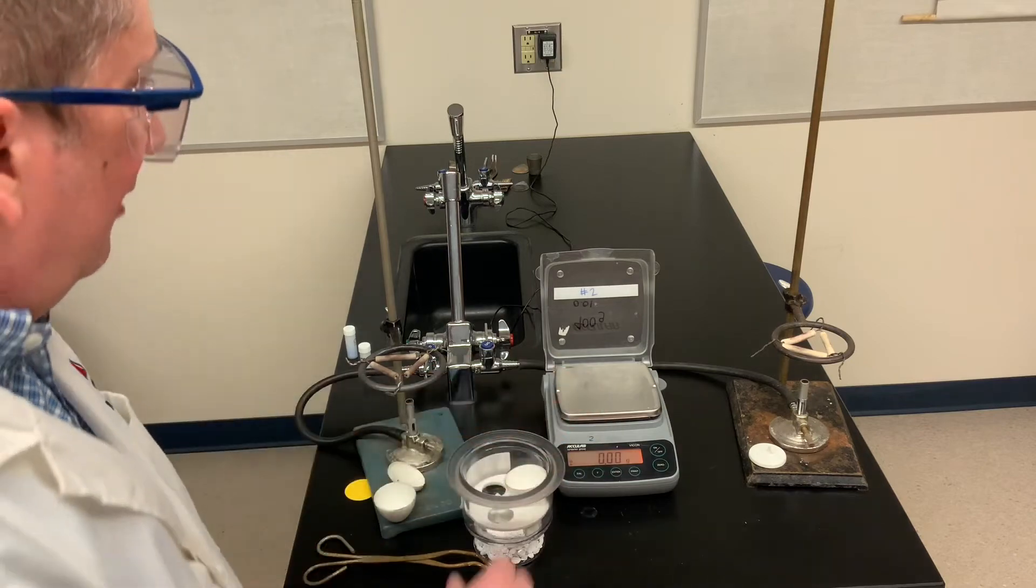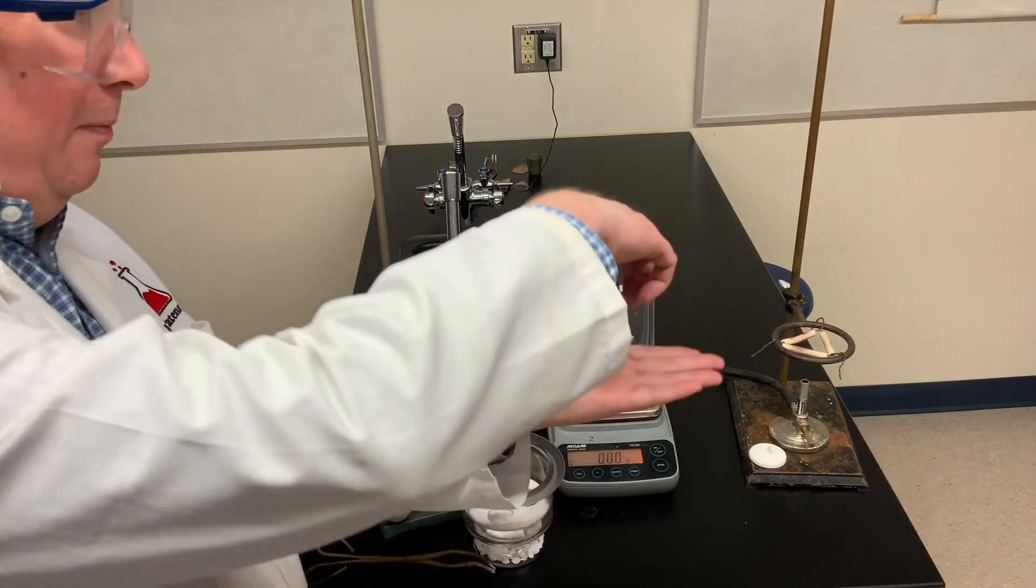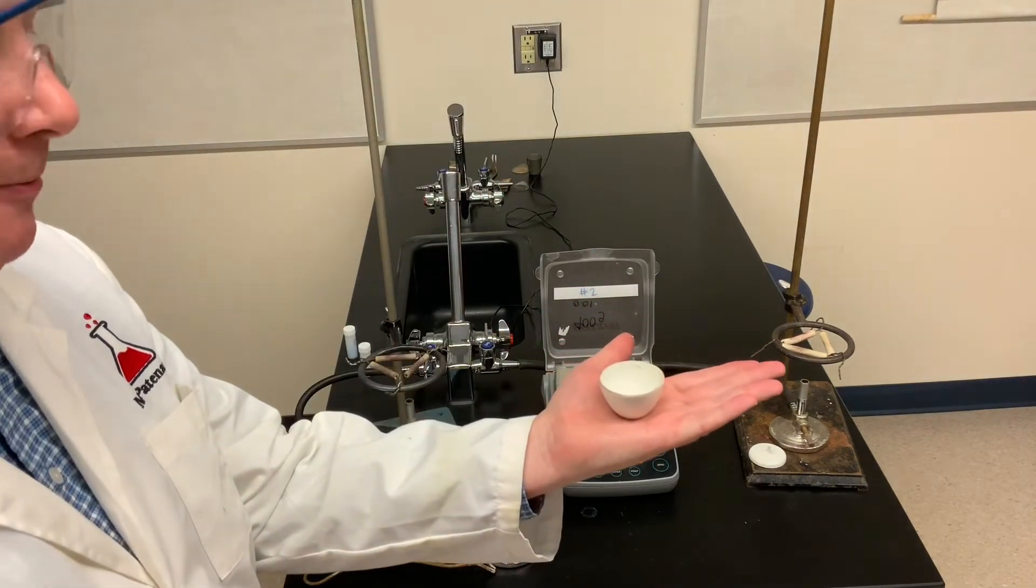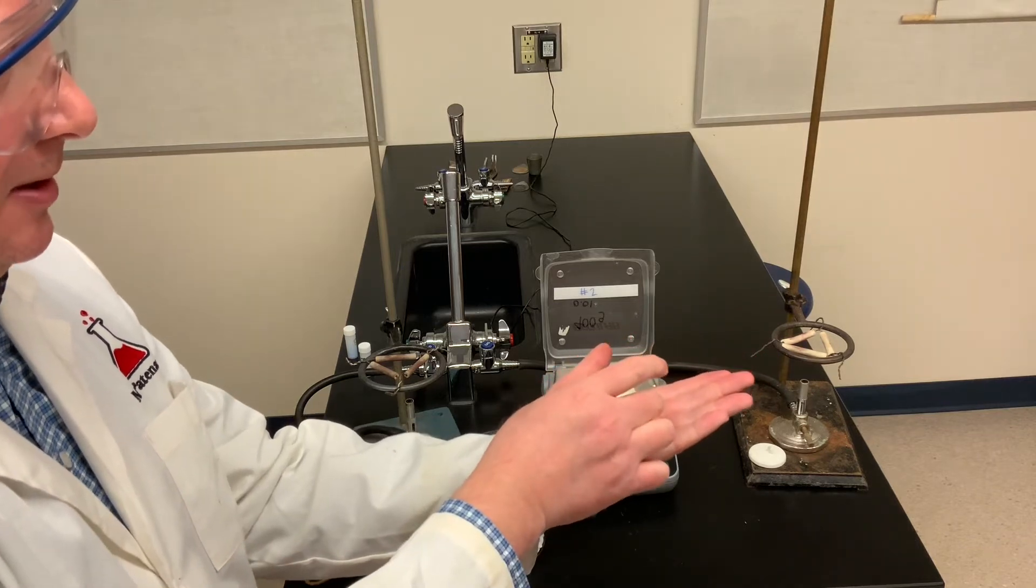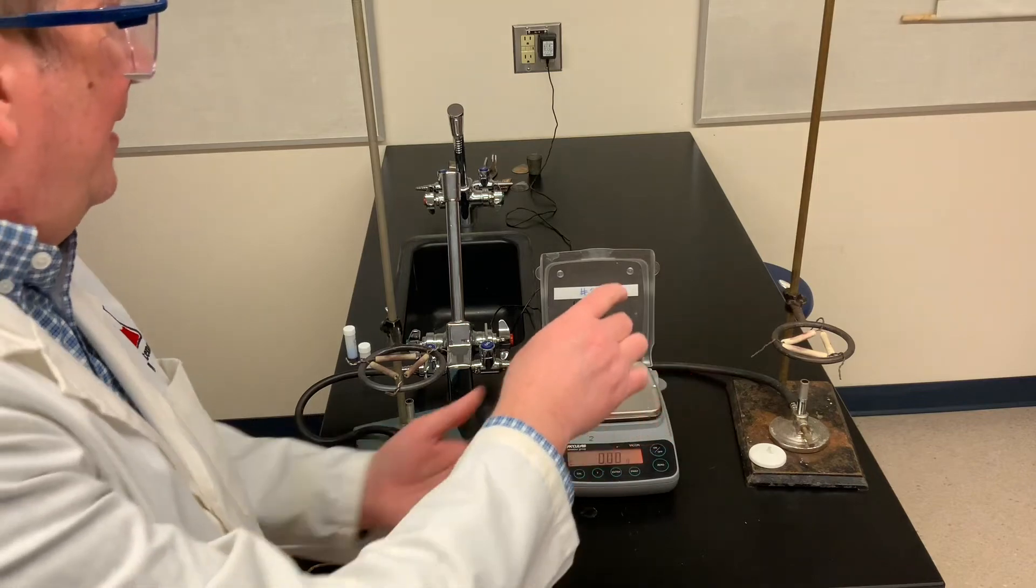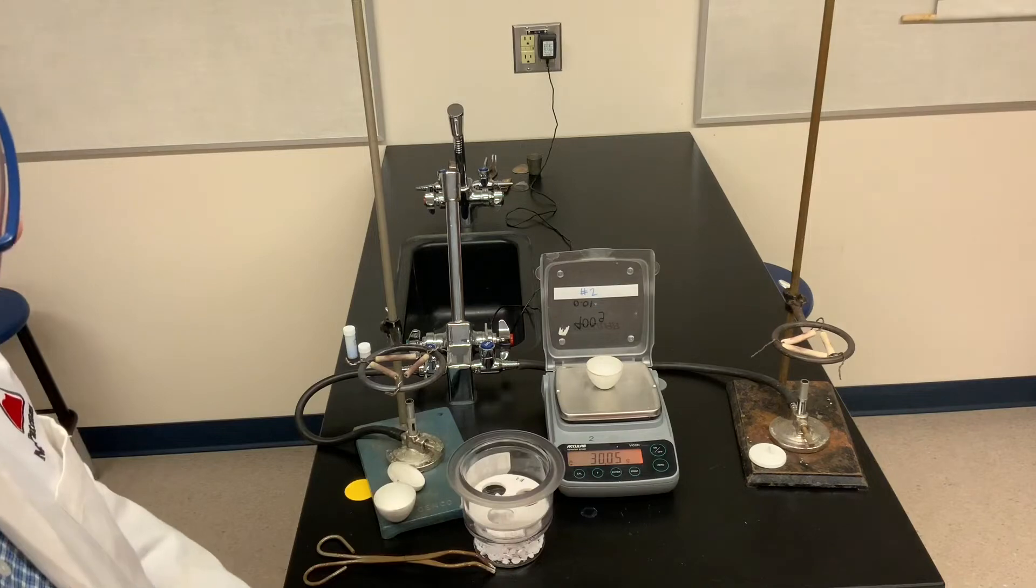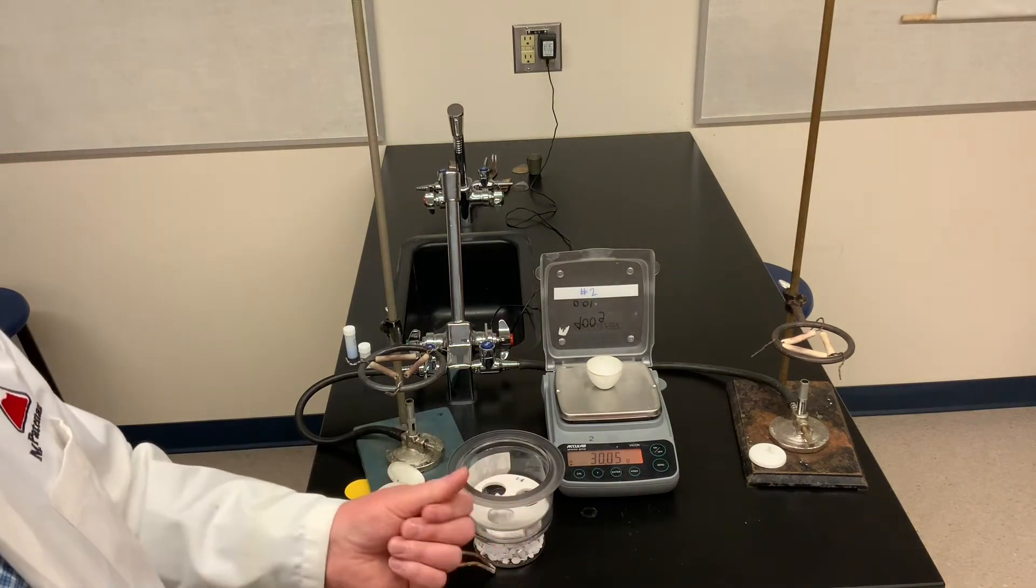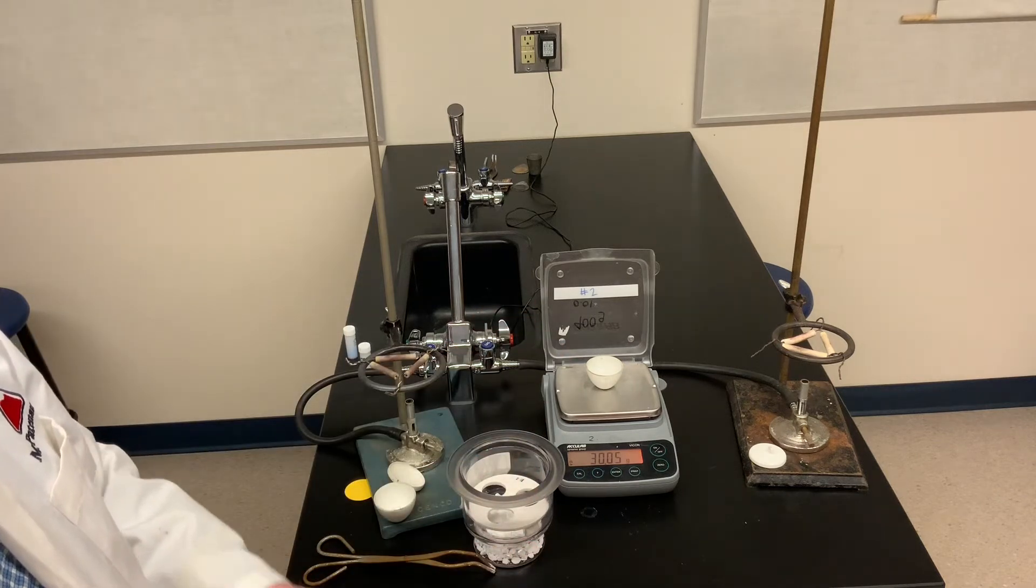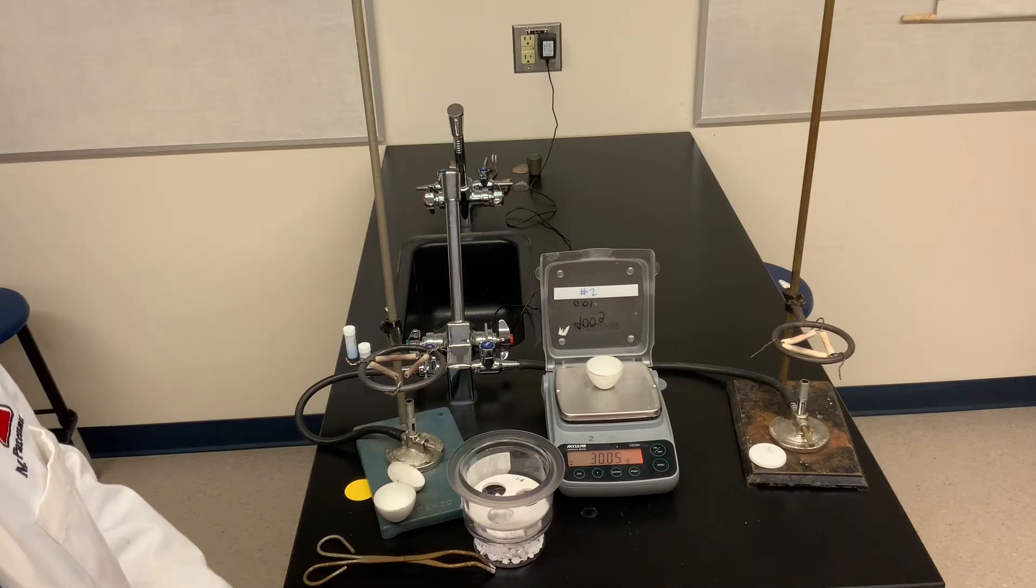So let's check the second sample. I don't feel any heat coming off. So I'm going to gently grab the top, put it over my palm of my hand. Don't feel heat. It's a little bit warmer than the first and a little bit less time to cool. But I think that's quite easily comfortable. I can weigh that. Now you might notice I touched a little bit of the edges of the desiccator. There was a little bit of that petroleum jelly. So I want to be sure I don't get any of that on the outside of my crucible, or that would affect its mass. So there's the mass of the second sample after heating.